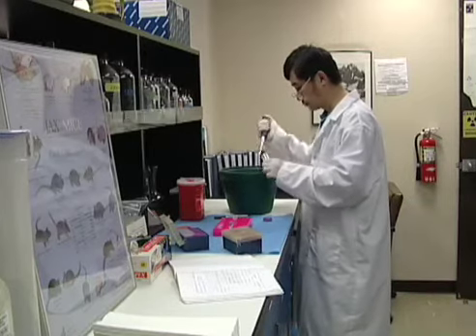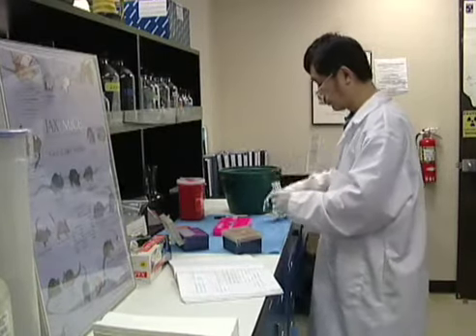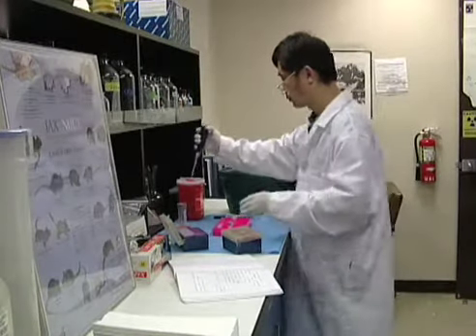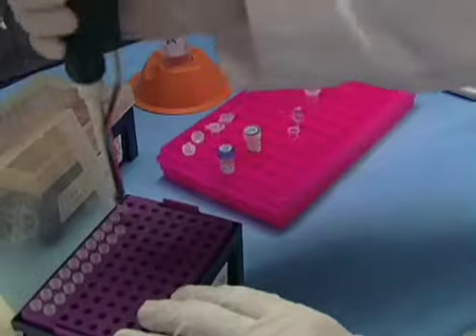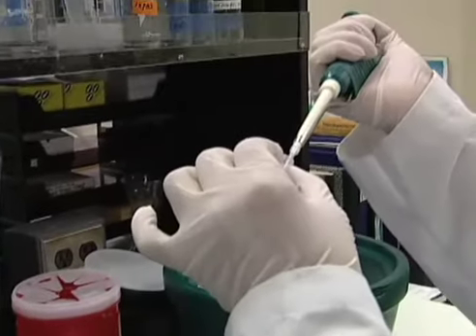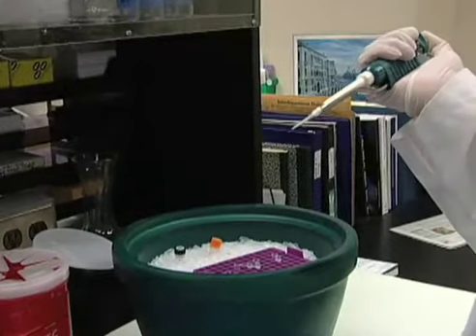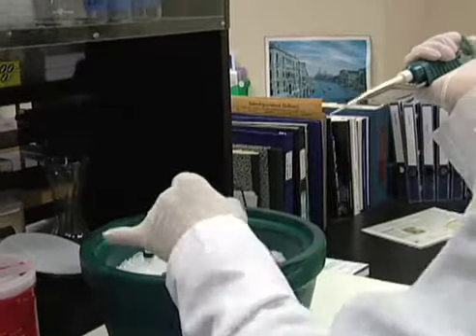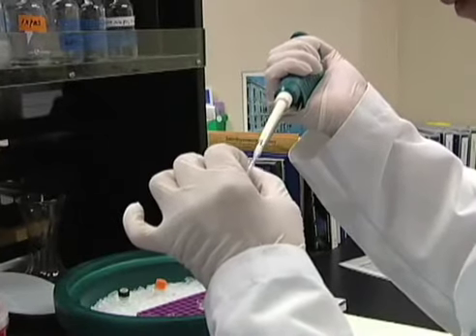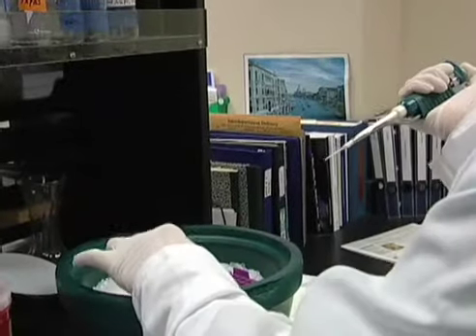This is the proteomics lab where we do experiments to try to understand the different proteins or protein interactions that produce different behaviors, such as the increased heart rate we see in MAOAB knockout mice. In this experiment today, we are comparing the heart tissue from wild type, normal mice, and MAOAB knockout mice, mutant mice.